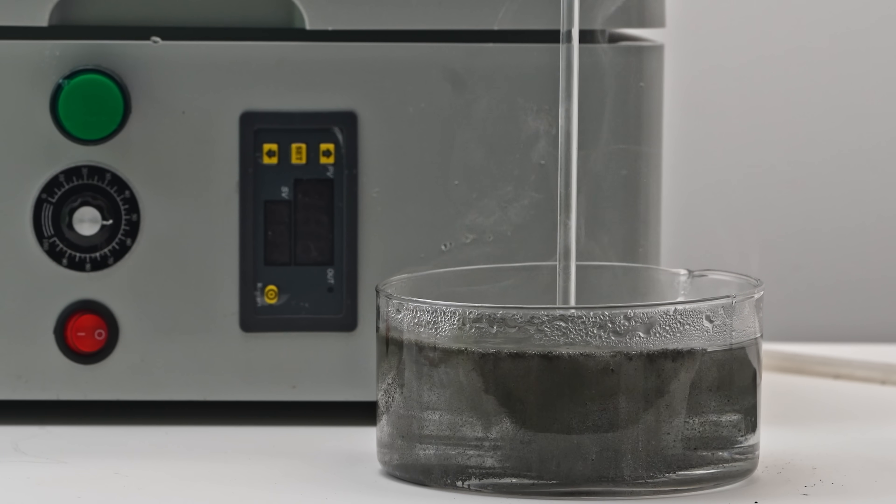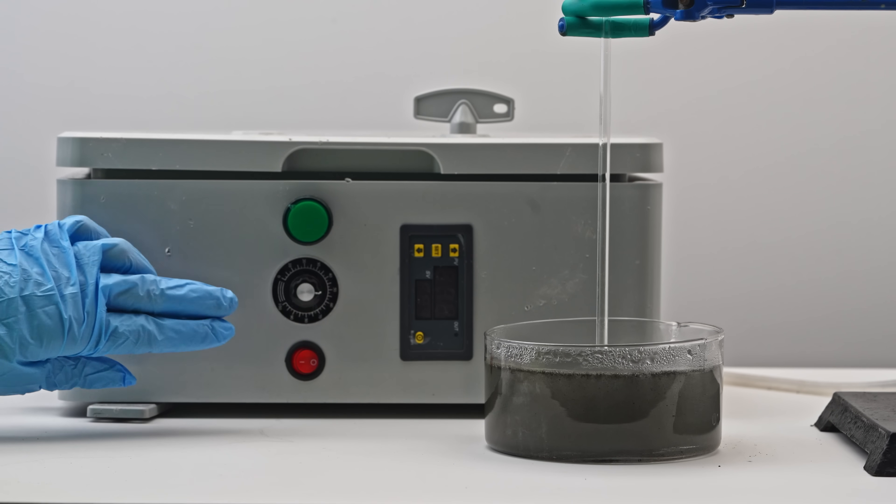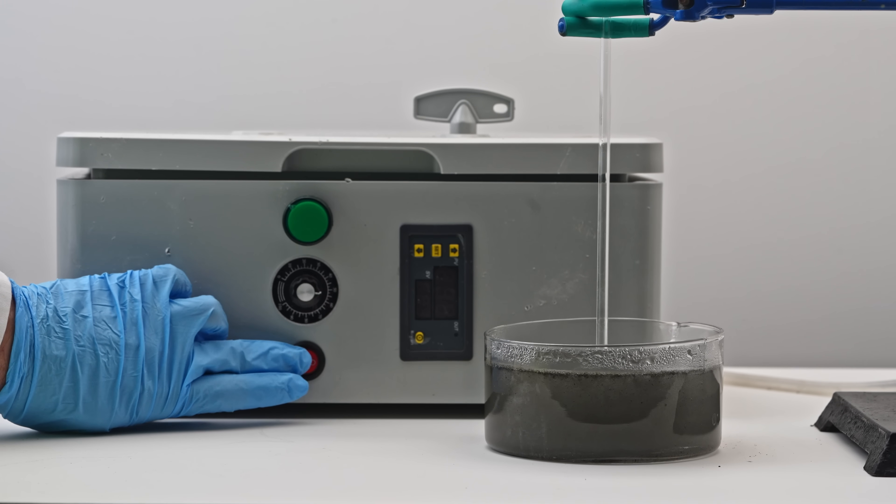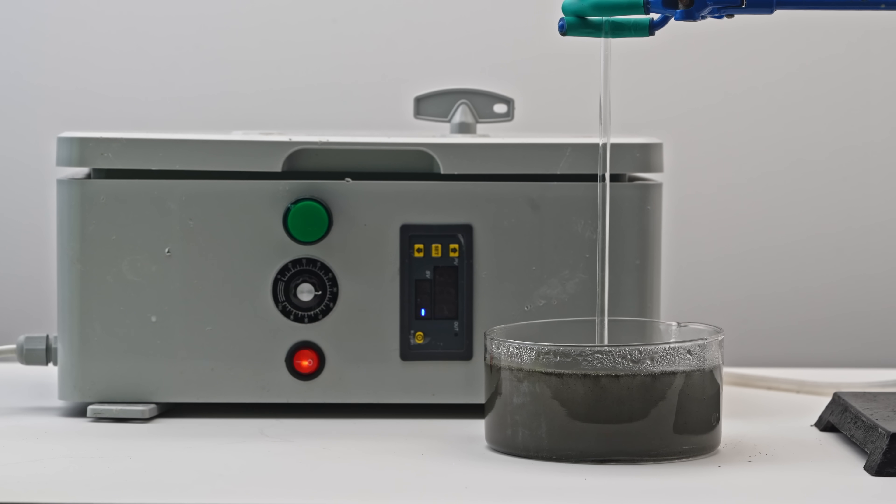And right after that, I turn on the ozone machine. In about 5 seconds, ozonated oxygen will start flowing through the tube. Watch what happens next.